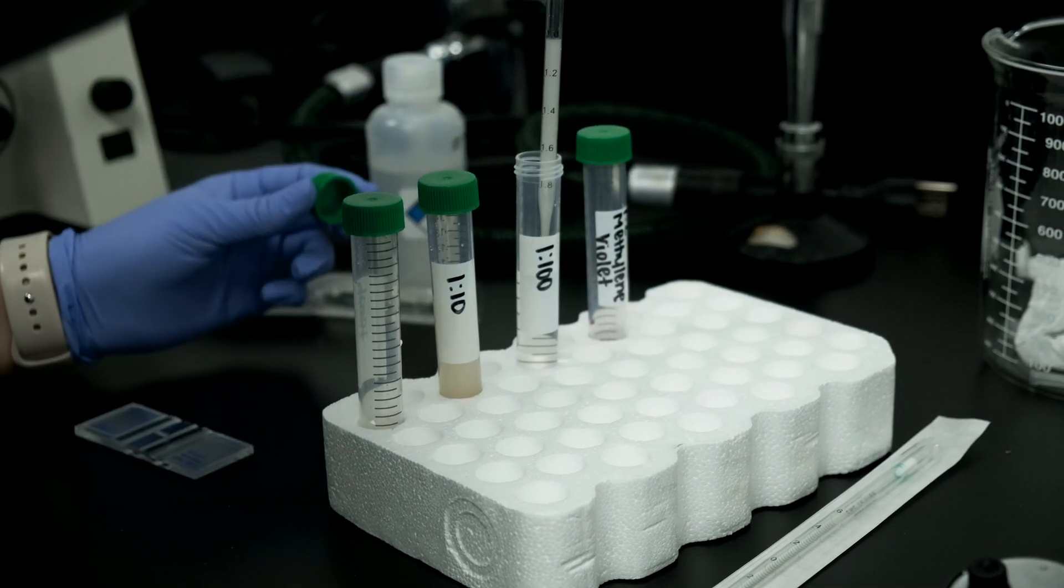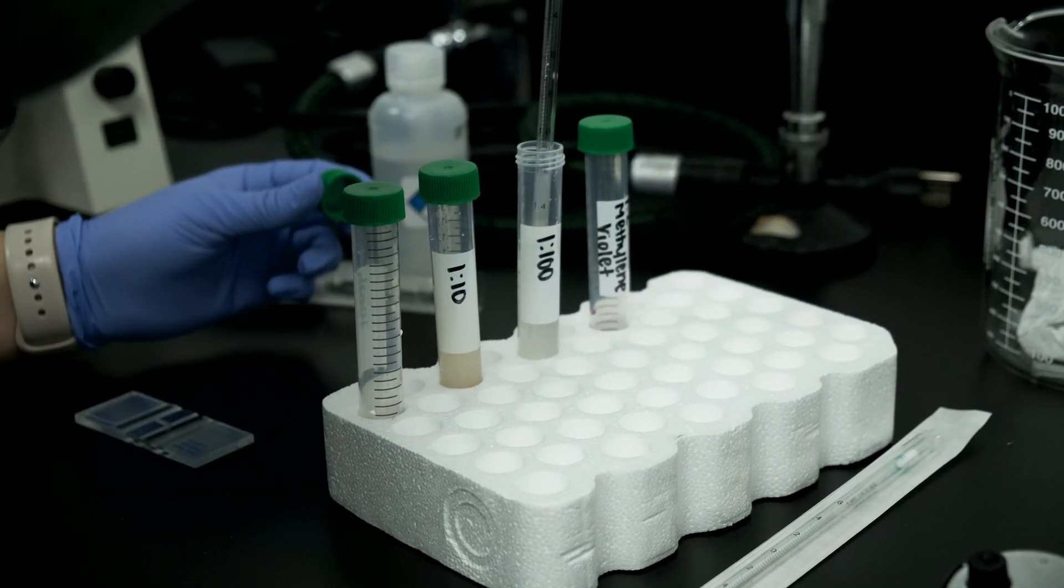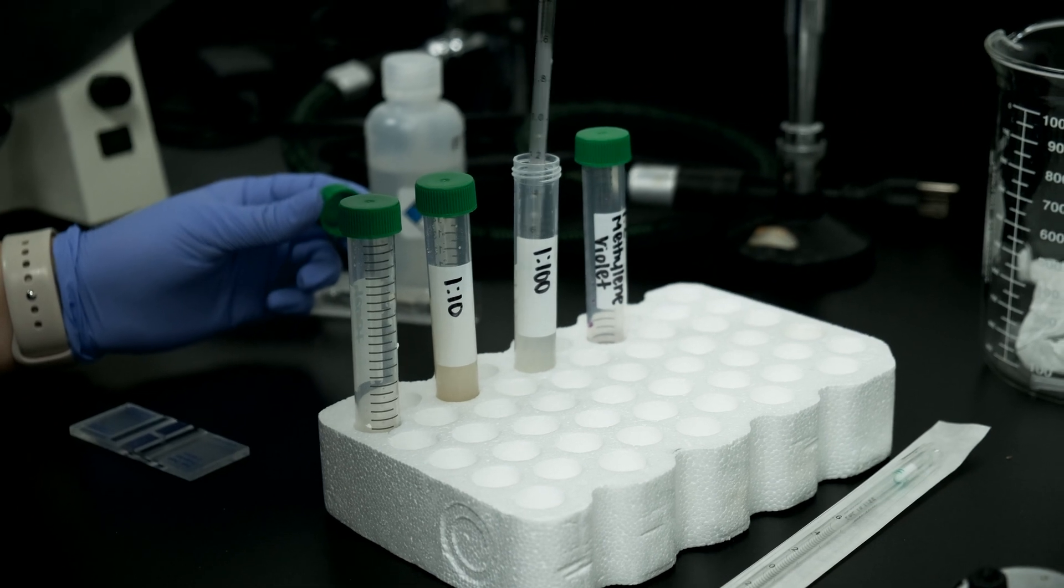Then transfer 1 milliliter of the diluted sample into an additional 9 milliliters of water to complete the 1 to 100 dilution.